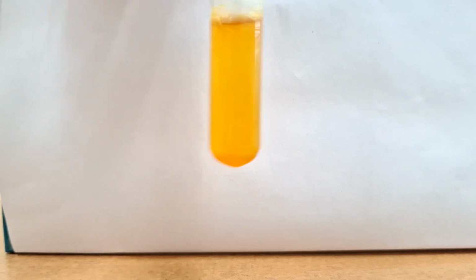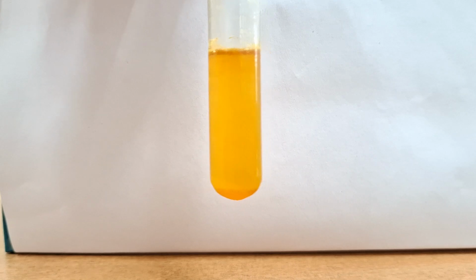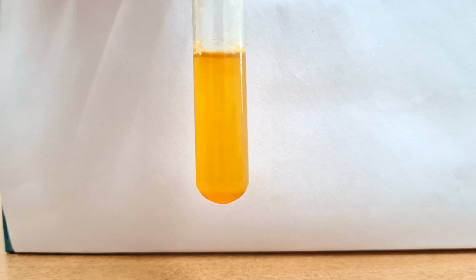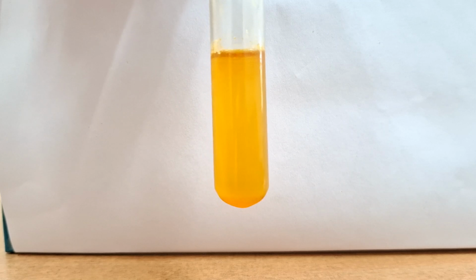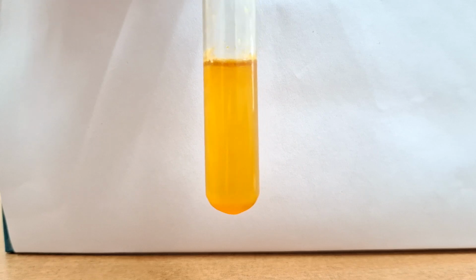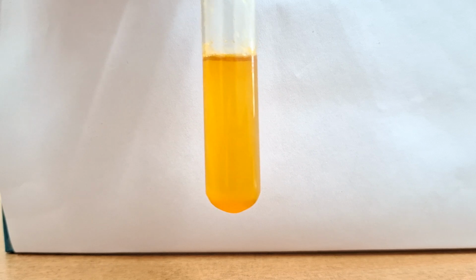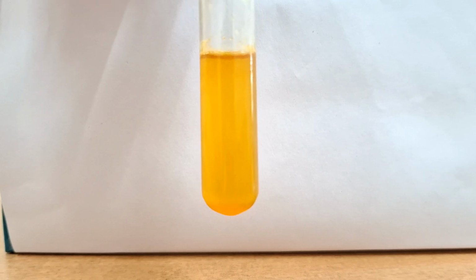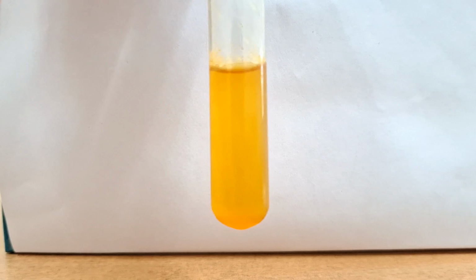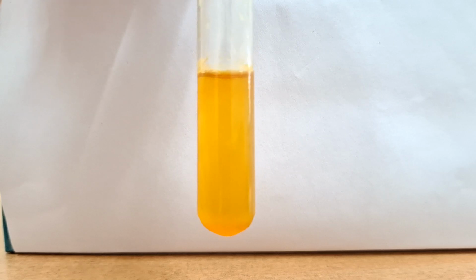Next in line you will see the xanthoproteic reaction. Okay, the xanthoproteic reaction is specific for amino acids which contain an aromatic ring, the aromatic amino acids. So you have to take 3 ml of solution and carefully add 1 ml of concentrated nitric acid, HNO3. Okay, and you have to boil it for 1 minute. After boiling, let it settle and cool for another 1 minute, and then add 2 ml of 40% NaOH and mix it well.